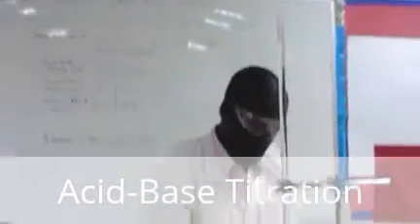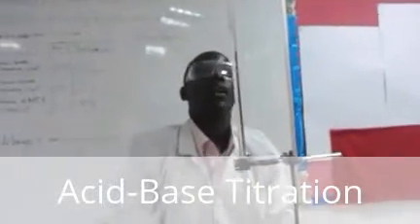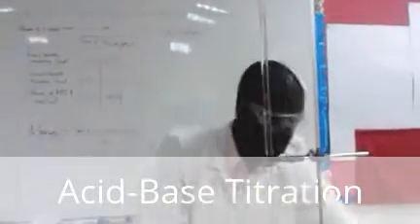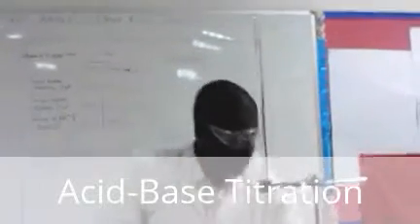I have bypassed, so I make sure I reduce. I'm at 0. Sorry. I cover the reagent bottle. Then this is the pipette.